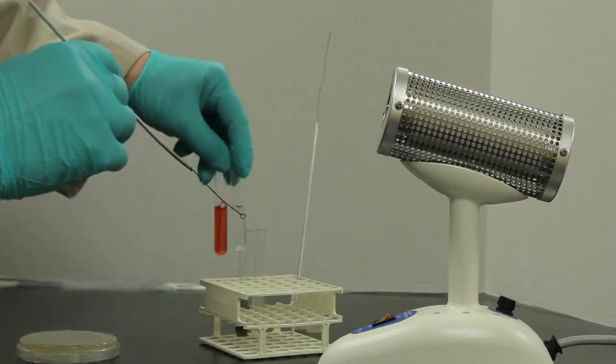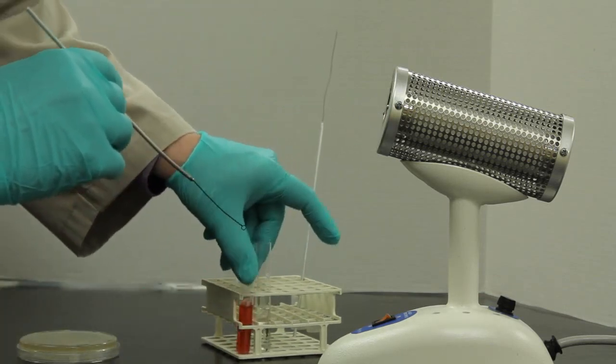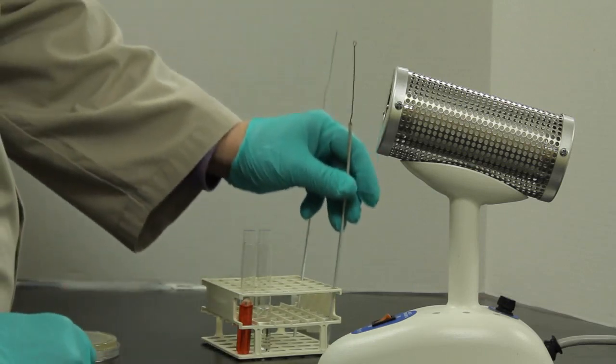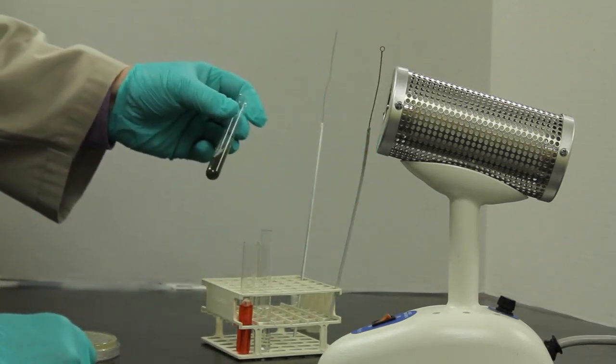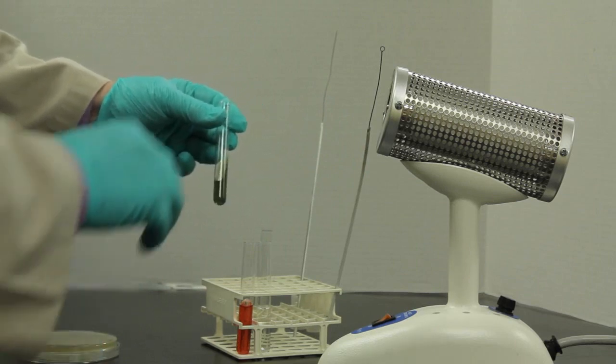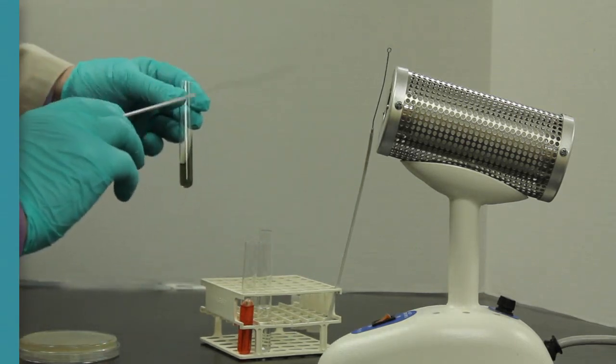So both of those liquids will inoculate the same way. Let's try one of the other medias. In order to inoculate a solid agar media, slanted media, we're going to use a needle.